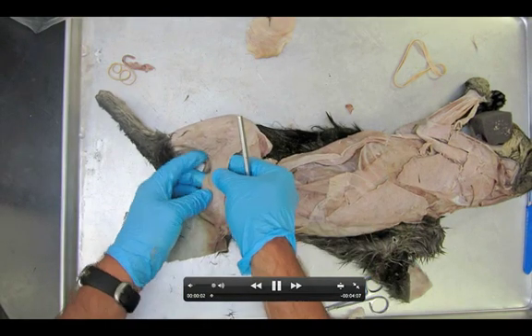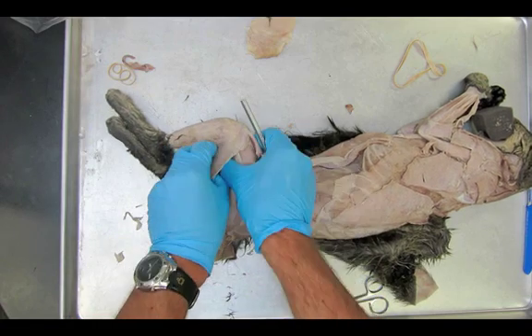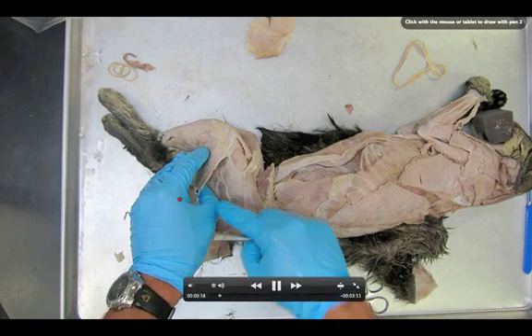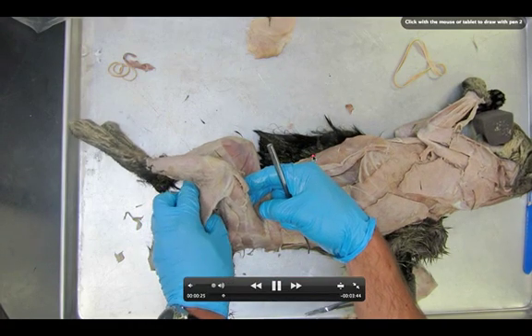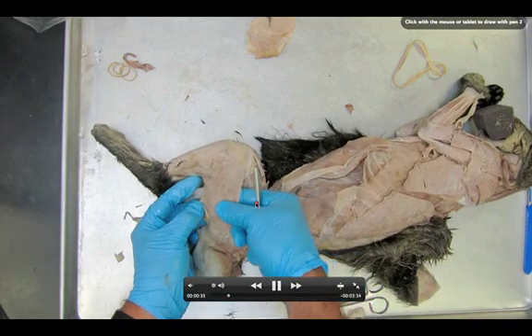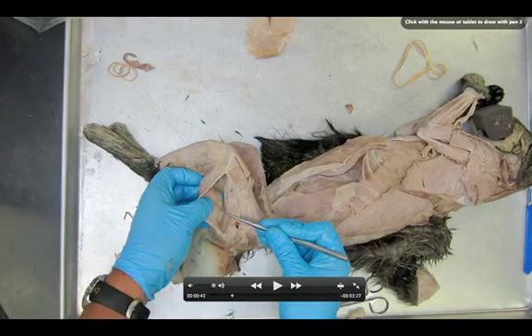You'll notice you're using your finger mainly. Be really careful about shoving a probe down inside of this pocket that you've made here. Now I'm going to locate the sciatic nerve first. You can easily see the sciatic nerve. We'll get it paused at a good moment where you can see it. I found it, and I'm actually going to try to find my way through and push a hole to the other side of the biceps femoris. I'm going to work very carefully with my finger. You can actually start seeing my finger coming through the other side.